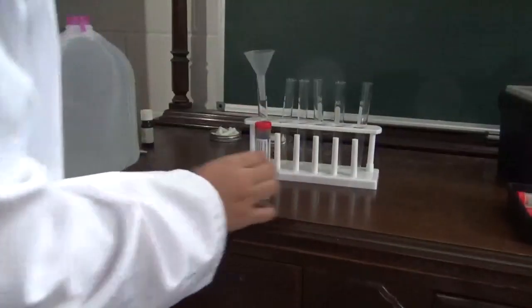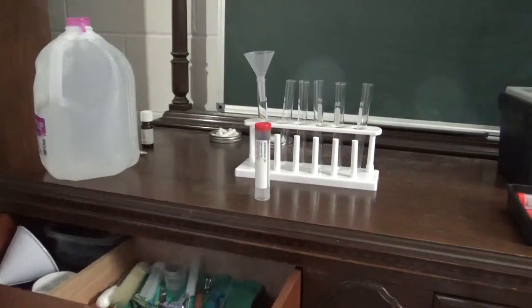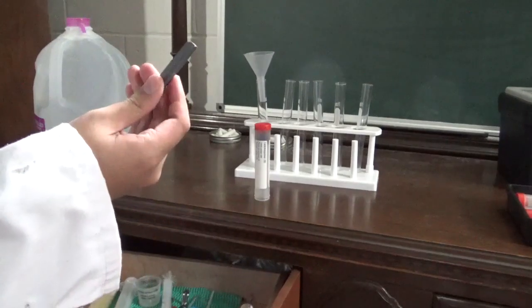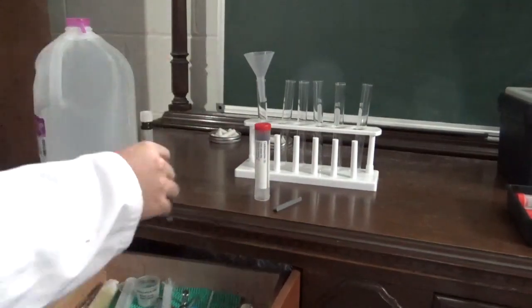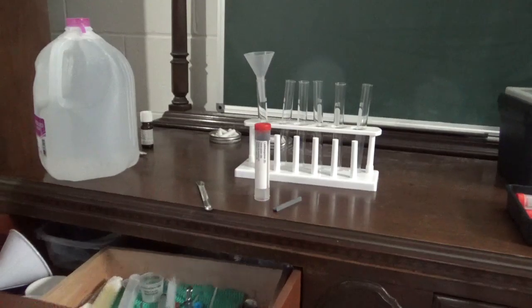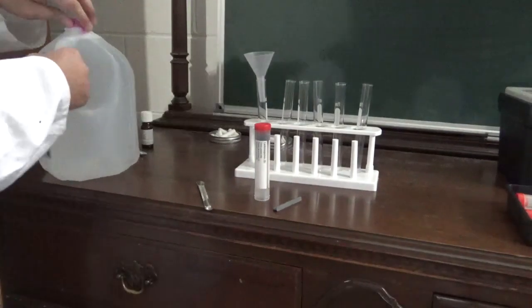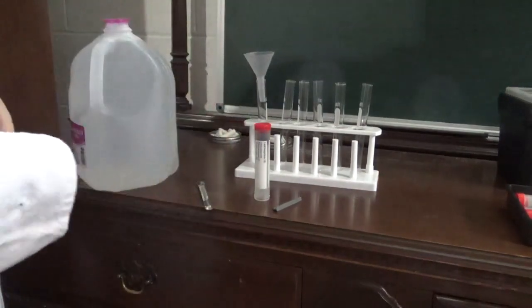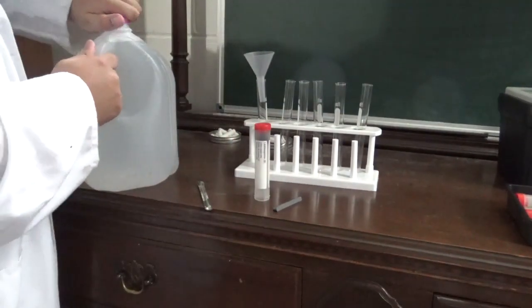So yeah, they said three centimeters of water. I don't know what the heck they're talking about, so I'm just going to guess. All right, we've got our litmus powder. You've got to use one of those fancy openers that was included with the Chem C3000.